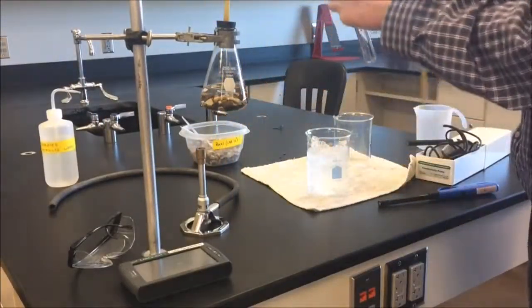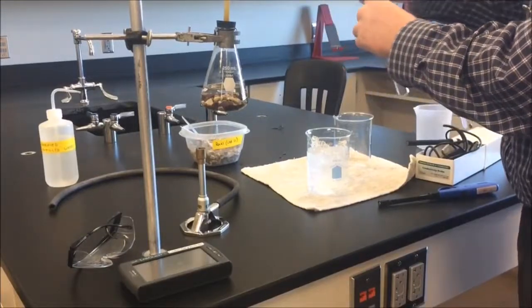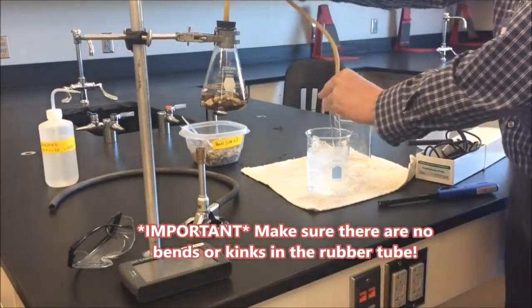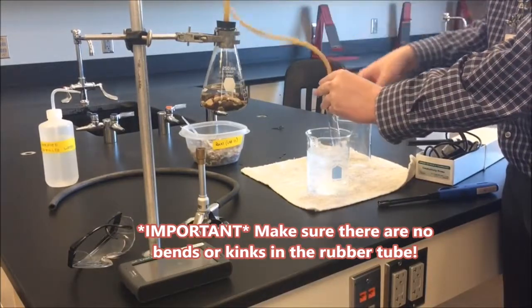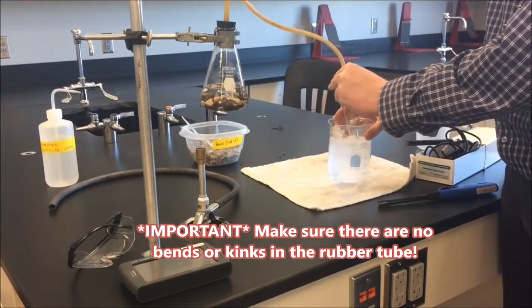Next we're going to take our rubber tube, we're going to feed it into the test tube. Make sure that there's no kinks or any kind of bends in the rubber tube before you run your experiment.